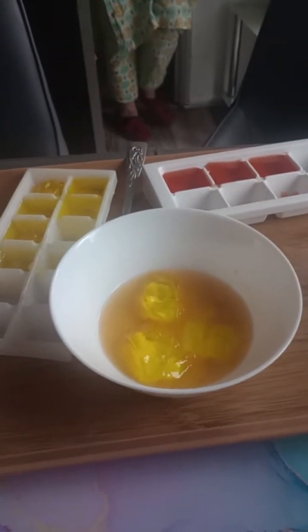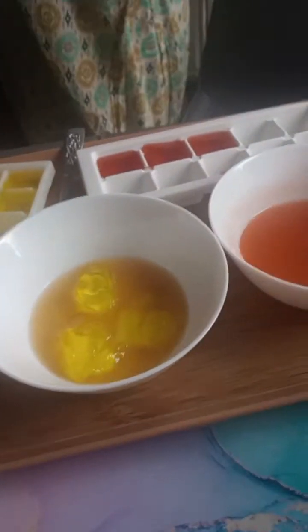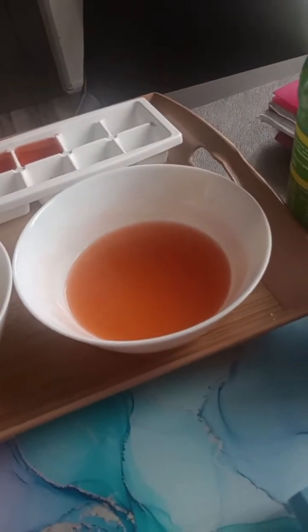And I appreciate it. See, this is what we need. We need someone like Noor to take part in these experiments when we're doing these live experiments. Oh, there you go, Noor. It's totally dissolved, like you said, so the heating one. So obviously, that's totally dissolved.